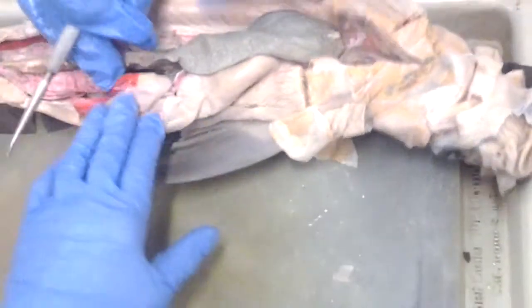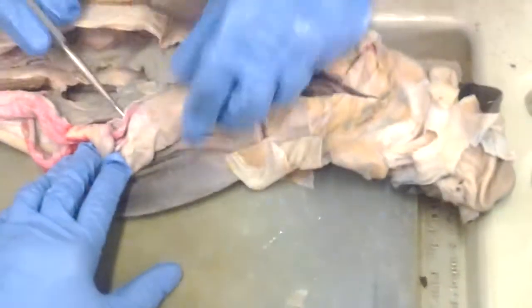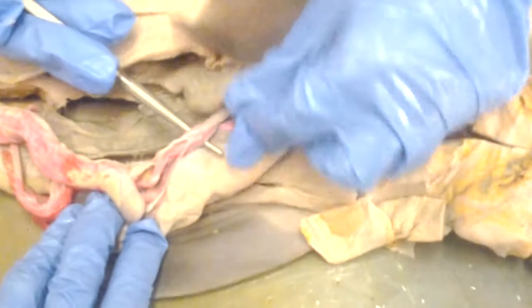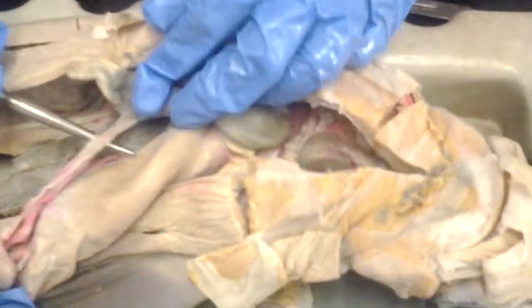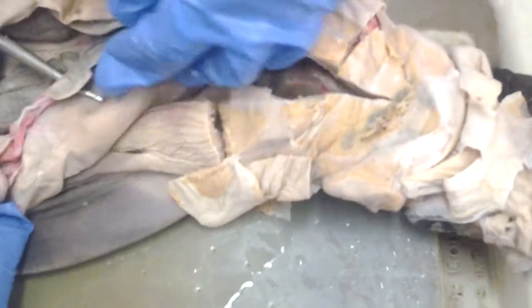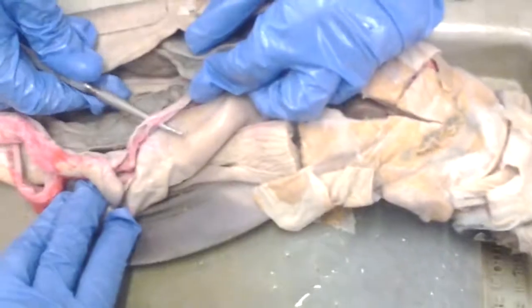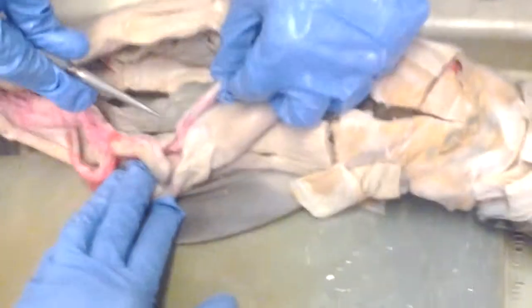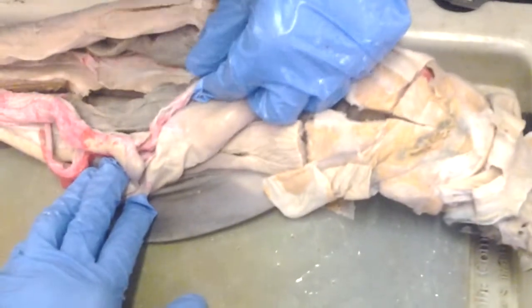And then next to it there was a ligament, the gastrohepatoduodenal ligament, right here. And it contains the bile duct, hepatic portal vein, and the hepatic artery. That divides up also. Yeah, it divides into two. It's Y-shaped. You need to study in your book.